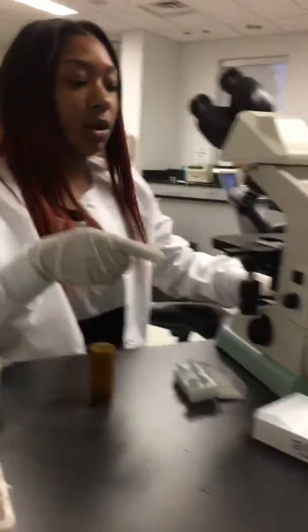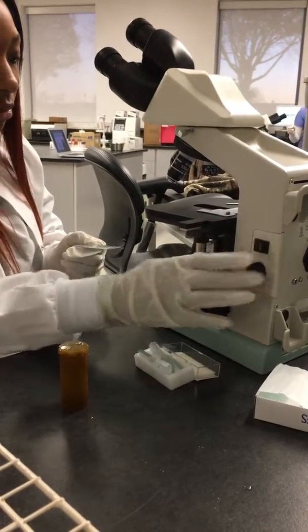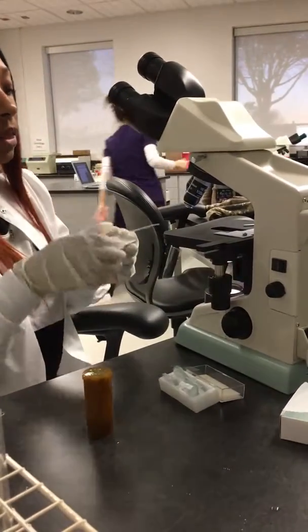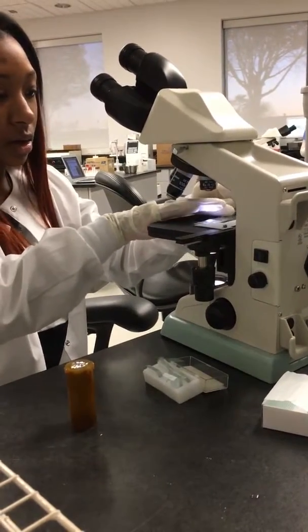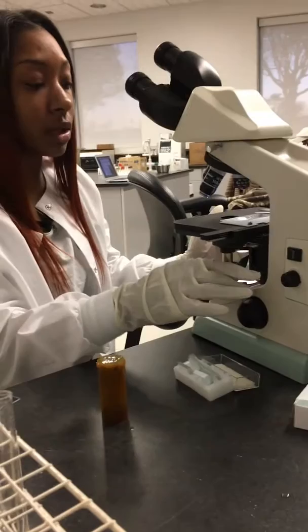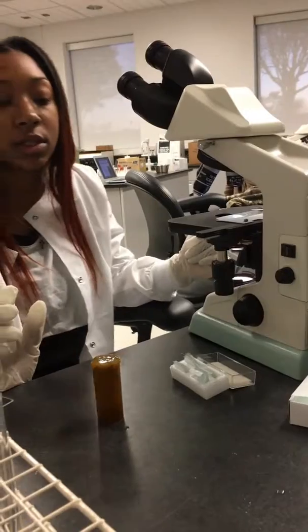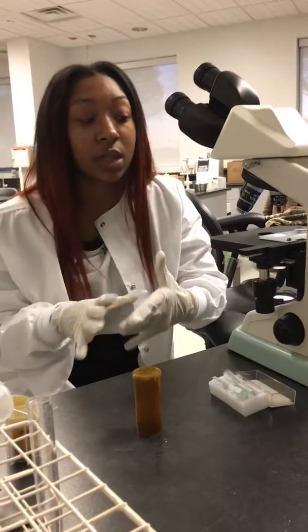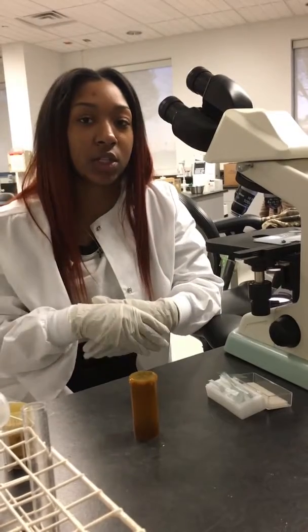And then once you've done that, you want to make sure that your microscope is on. Make sure that the stage is all the way down. And you want to go ahead and place your slide onto the microscope stage. Before you look into the microscope, you want to make sure that you have your sample in view. And once you have it in view and in focus, you want to use the snaking method to look through the entire slide. And if you think that you see something, you want to move up to the 10x objective and get a closer look and make sure that you can see everything.